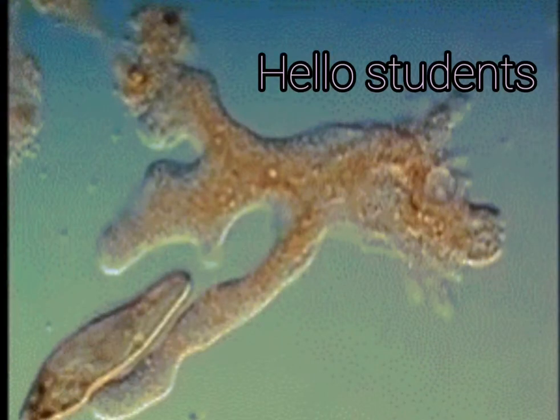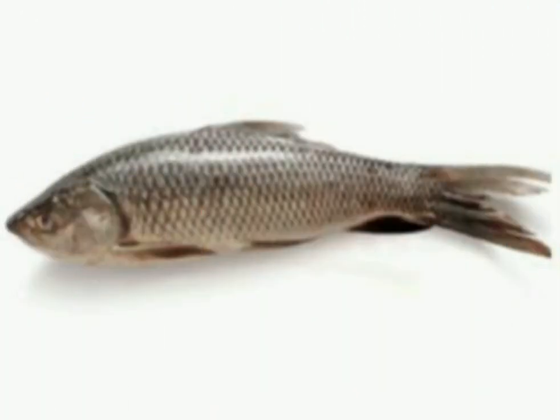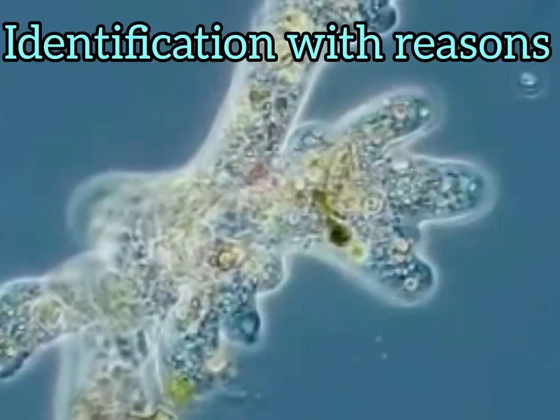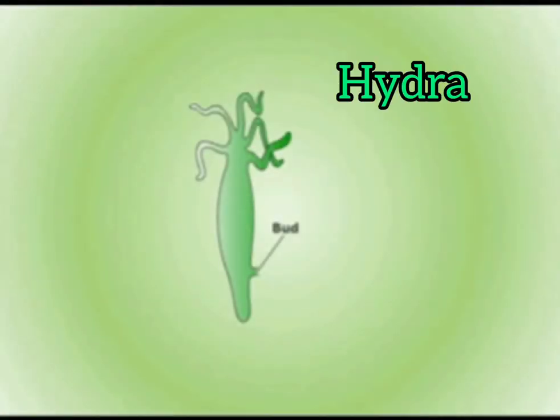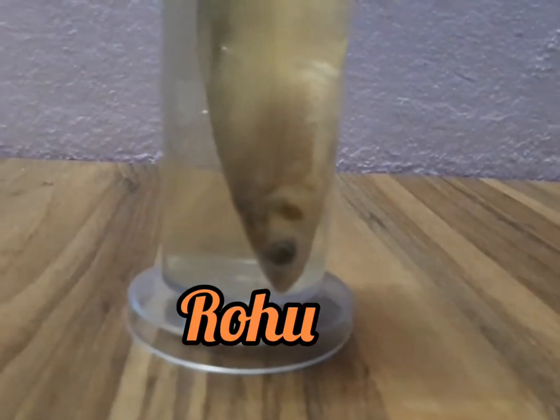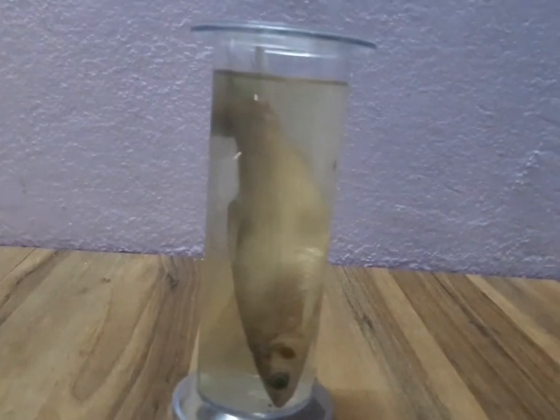Hello students, this is another experimental activity for you, Class 11. Here I am going to discuss about the study of the characteristics of specimens through slides and models and their identification with reasons. In today's video, I am going to discuss about Amoeba and Hydra through slides, Ascaris through a model, as well as Rohu, that is a bony fish, through a model. So let us start the activity.